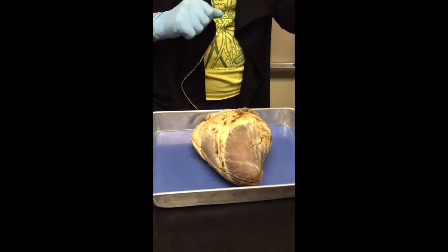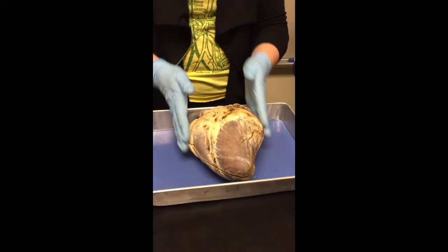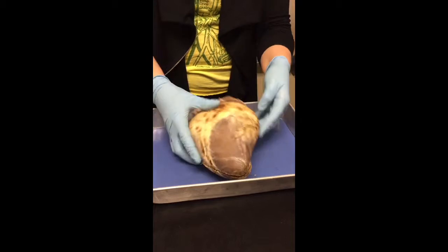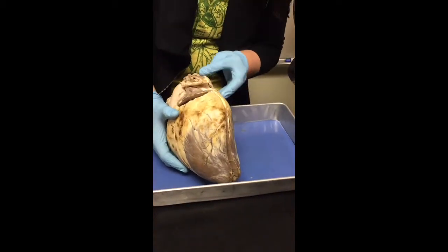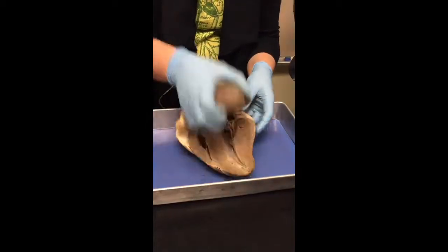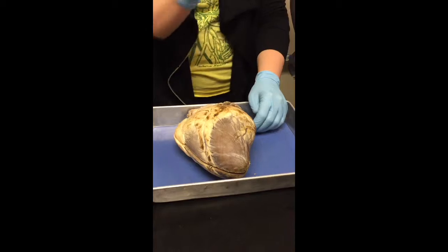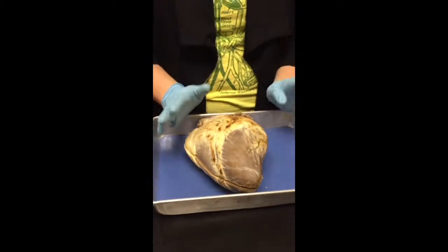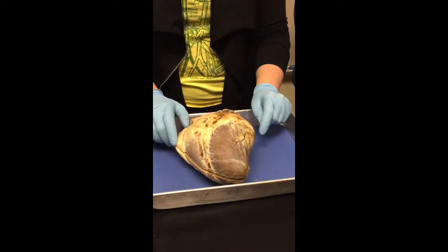Fantastic. Okay, so we go from the lungs through what we call pulmonary veins. You don't have to identify pulmonary veins on this because they've been cut away. Like right here, there would be a few pulmonary veins on this side because this is the left side of the heart. I don't have it on the list, but you should know it in the flow of systemic blood, but I don't think you can identify it on any of the models.